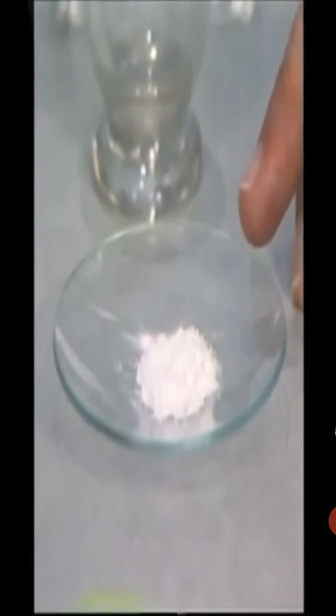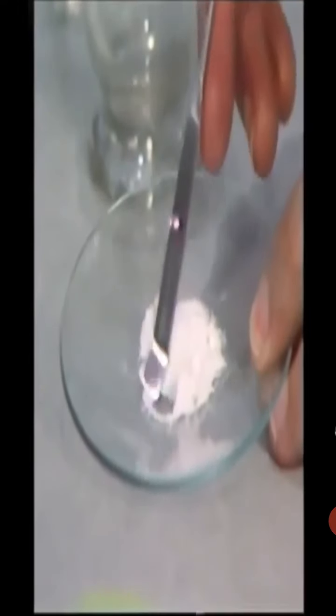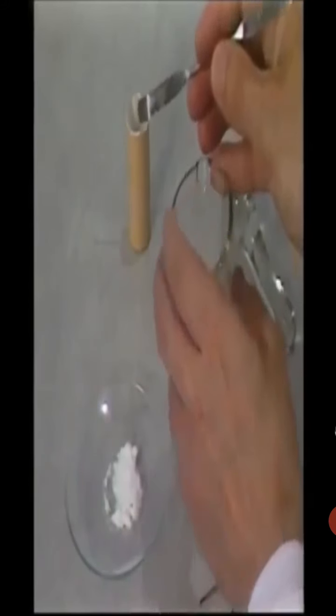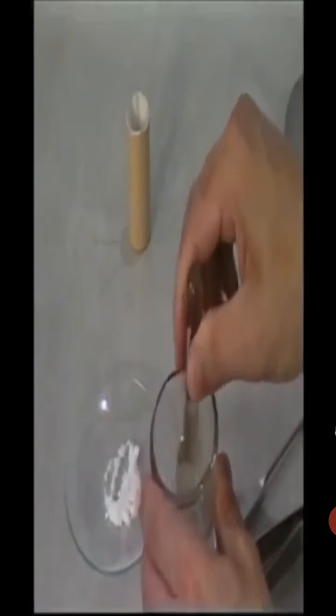I shall now show you how to prepare a sample for melting point determination. For the measurement, we shall use this apparatus. The sample for melting point measurement needs to be finely ground. This you can do using a spatula, pressing the sample firmly onto the surface of a clock glass. Alternatively, and more satisfactorily, the sample can be ground in a pestle and mortar.